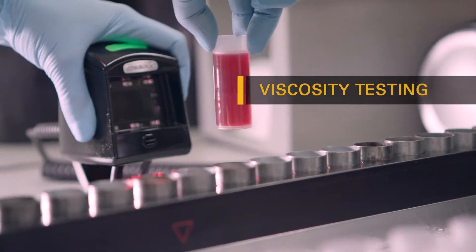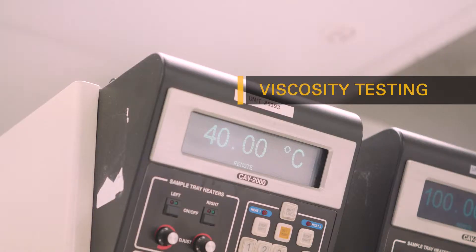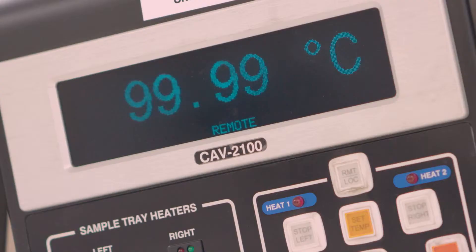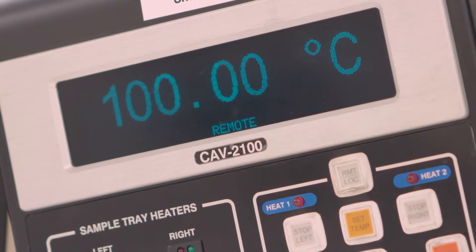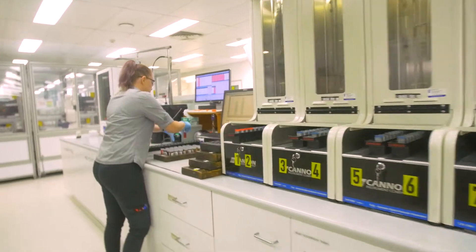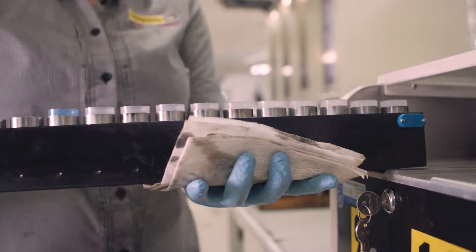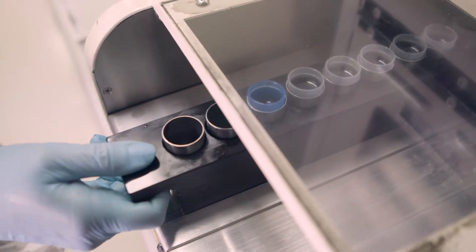Viscosity testing is completed at 40 degrees Celsius; however, engine oil is also tested at 100 degrees Celsius to measure the fluid's flow characteristics. Ensuring the correct viscosity oil is in use is one of the most important elements of condition monitoring.